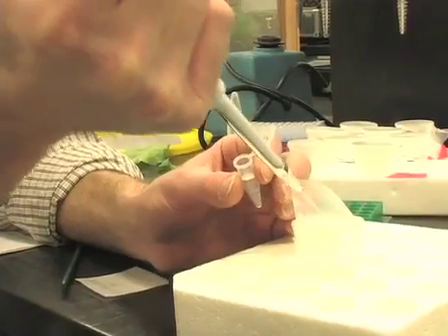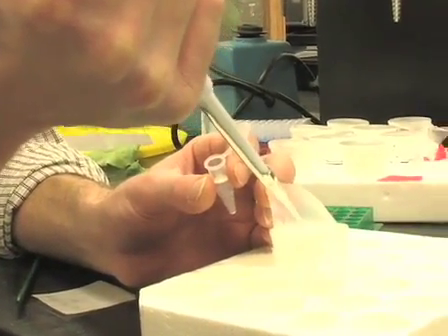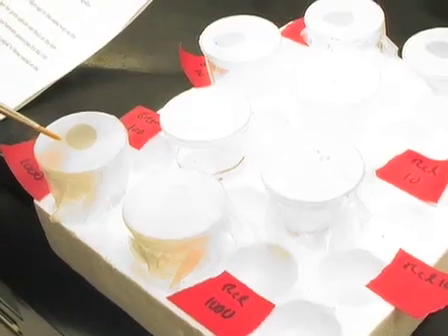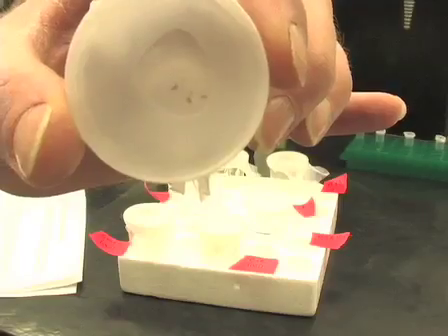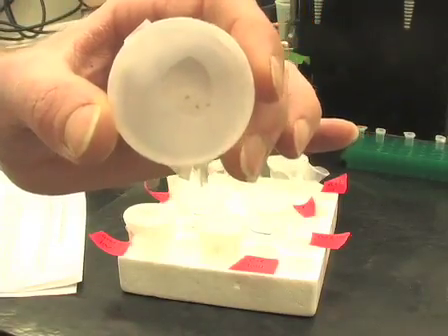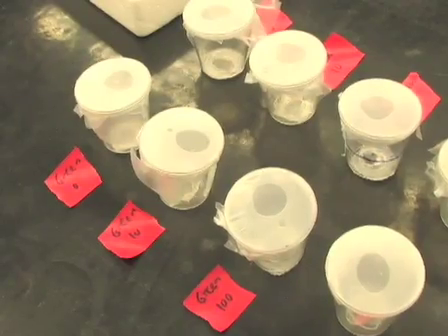This procedure involves preparing an artificial diet to which the plant metabolite of interest, in this case nicotine, is added at varying concentrations, caging aphids such that they feed on this diet, and counting aphids after a number of days to measure the survivorship and fecundity on different concentrations of nicotine. So let's get started with the experiment.